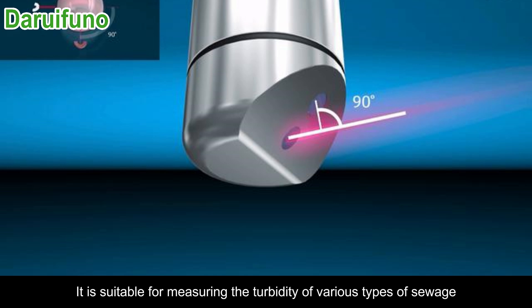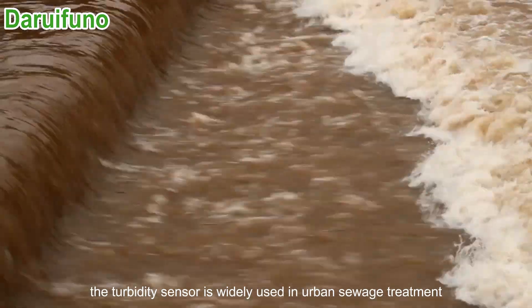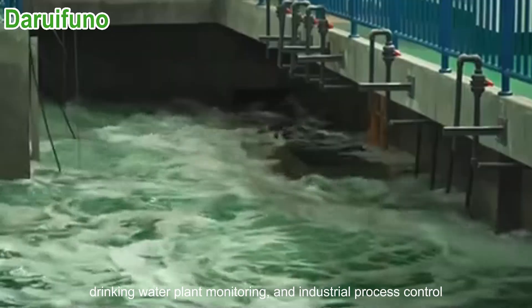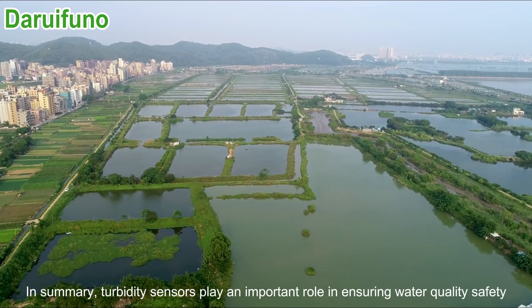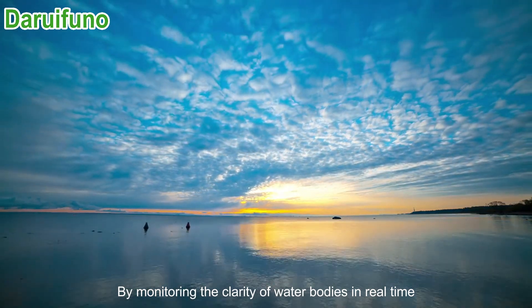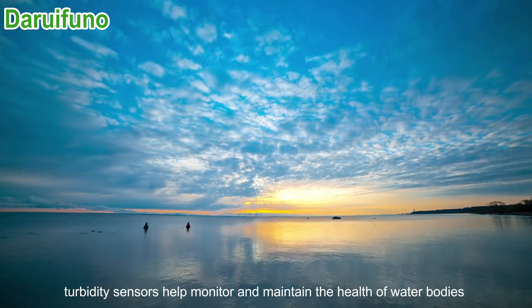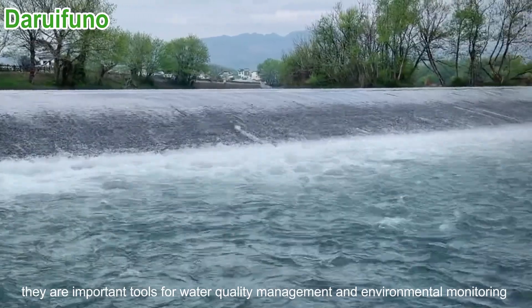It is suitable for measuring the turbidity of various types of sewage. The turbidity sensor is widely used in urban sewage treatment, drinking water plant monitoring, and industrial process control. In summary, turbidity sensors play an important role in ensuring water quality safety, environmental protection, and water treatment control. By monitoring the clarity of water bodies in real time, turbidity sensors help monitor and maintain the health of water bodies, making them important tools for water quality management and environmental monitoring.